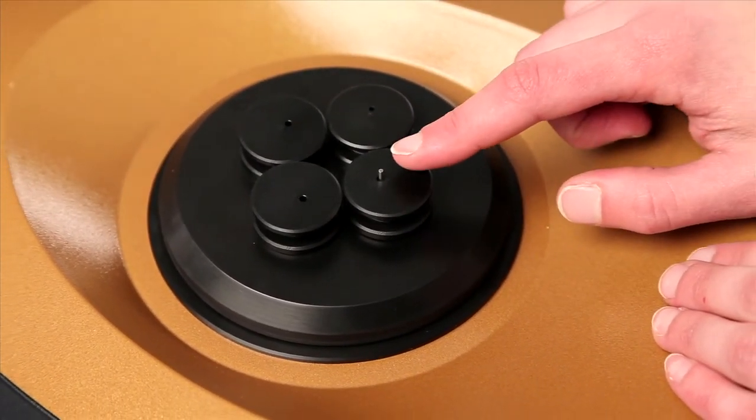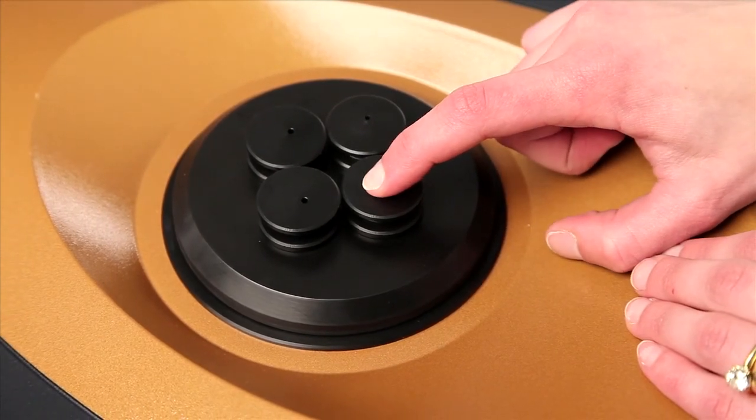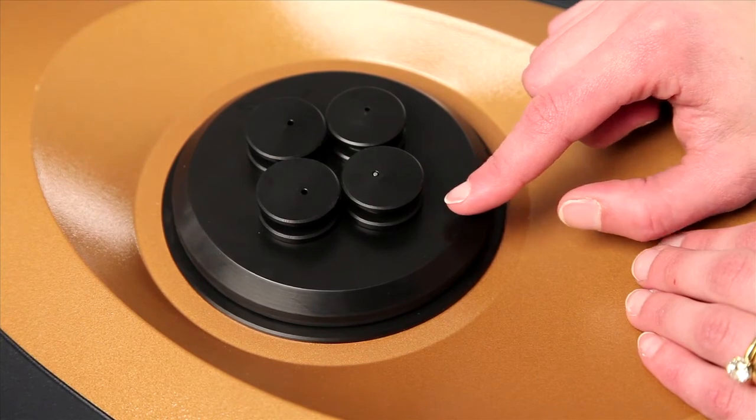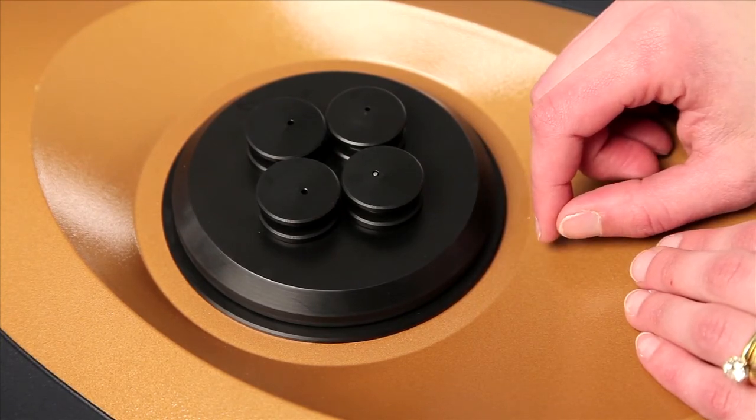After a period of time, the rod can be pushed down, and the solid in the top inner chamber is introduced into the liquid down in the bottom in the outer chamber.